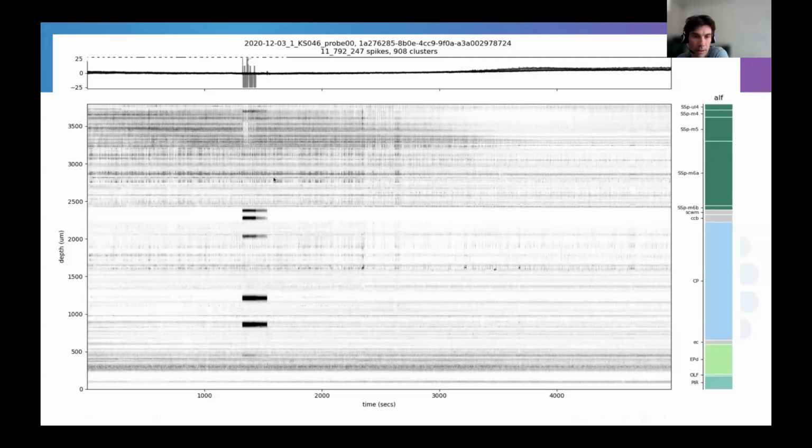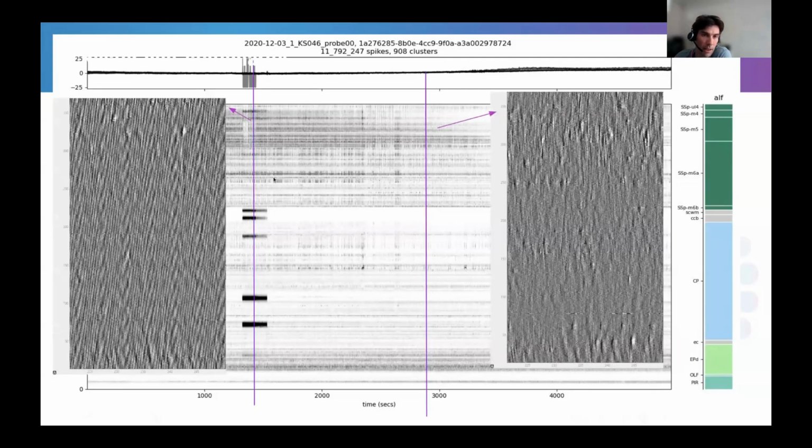And if you think that this is due to an artifact, you would be right. If you look at the raw data, you can clearly see that the raster is showing that the raw data here is corrupted, while here it's quite good. What is happening here is that it's a drying of the saline solution that creates a lot of noise in this area. So by adding more solution here, they could fix the problem and continue the recording.